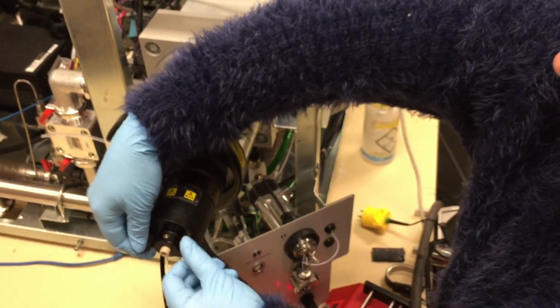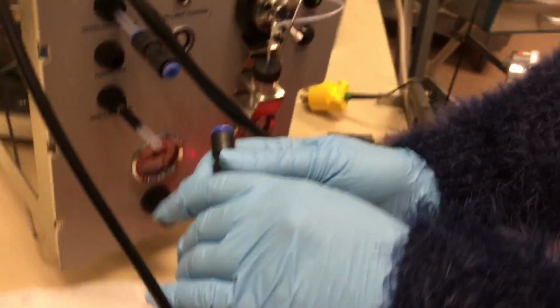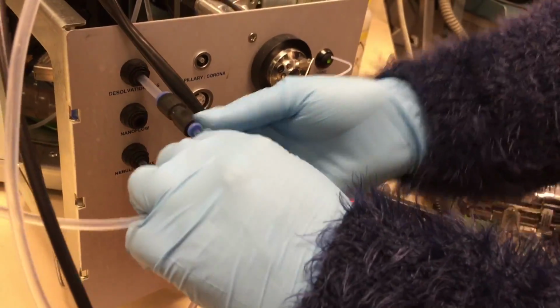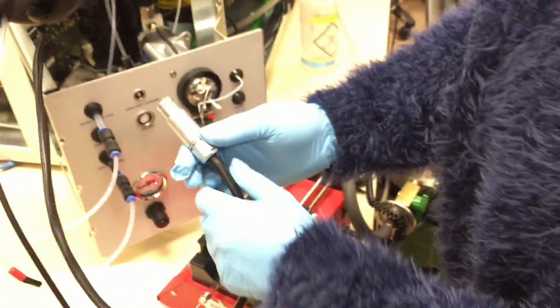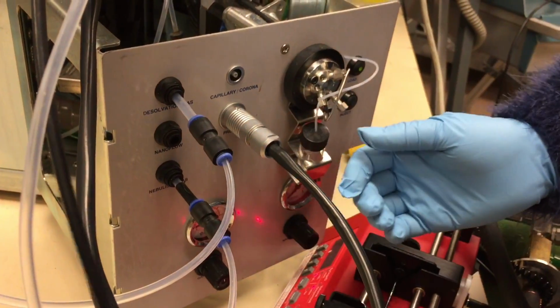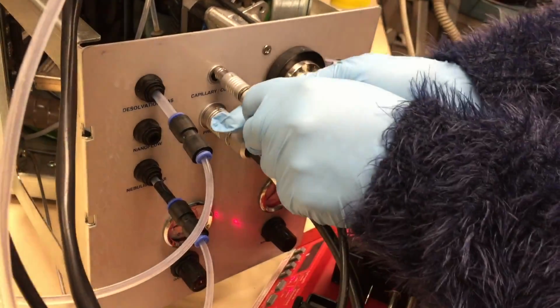Screw the probe into the source. Everything's connected. I'm going to reconnect the hoses. This one is for nebulizer gas, the desolvation gas on the top. The electrical connection for the probe. Note the red dot goes on the top. It will only fit in one way. This is for the capillary. Doesn't matter how that one goes.